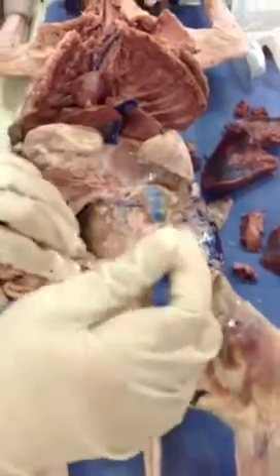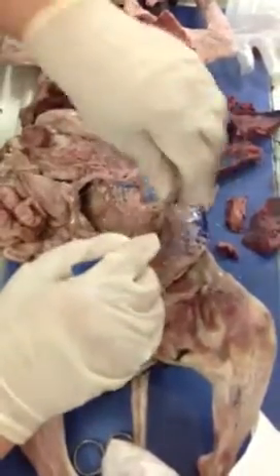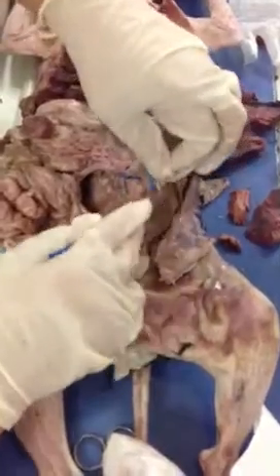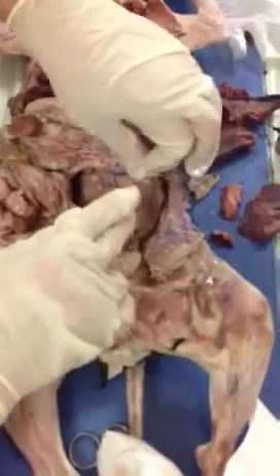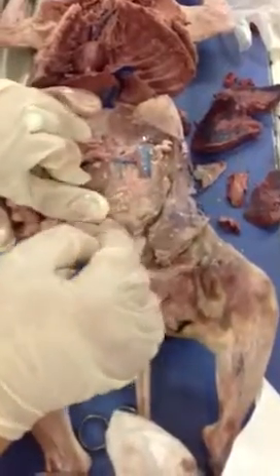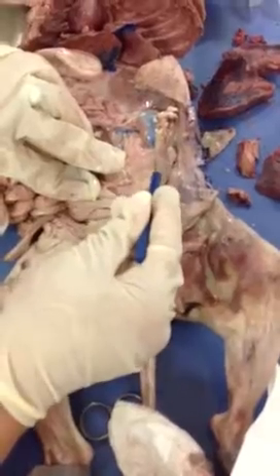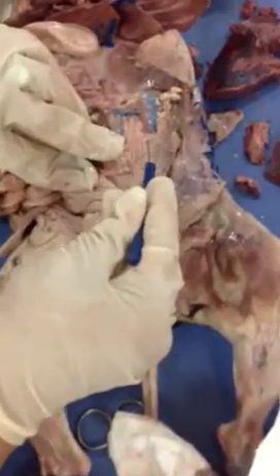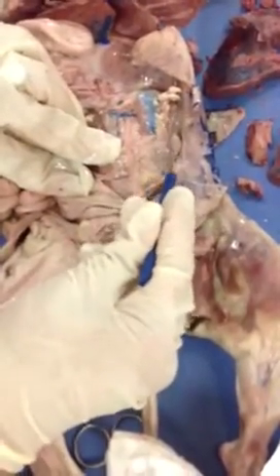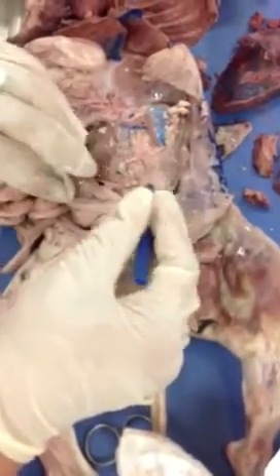Okay? Please continue. Genital. Renal meaning going to the kidneys, right? Yes. Now, in those genitals or gonadals, if it's a female, as we have here, it's going to be called ovarian, and we can follow it. You see how it's going towards the ovary? If it's a male, we call it spermatic. You see? This is my ovarian artery.